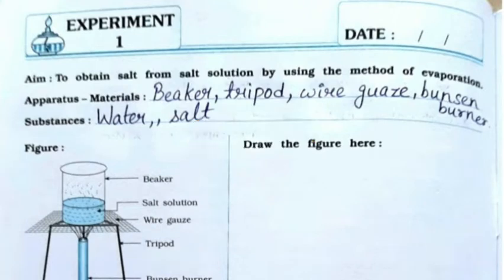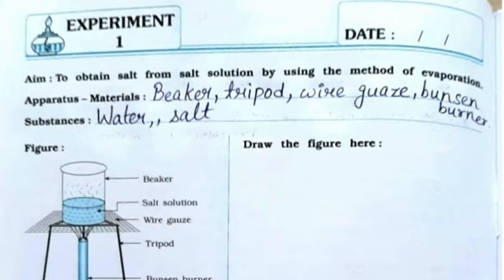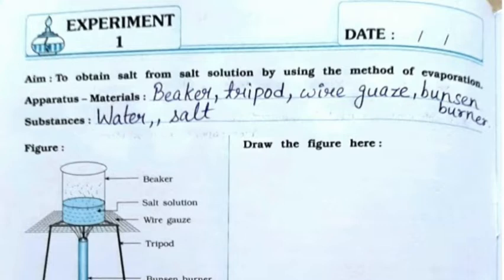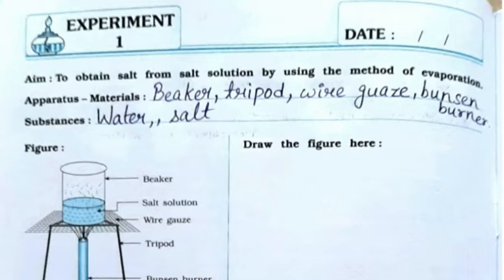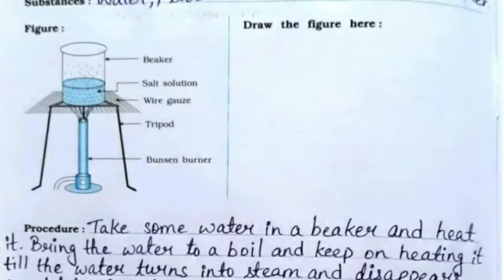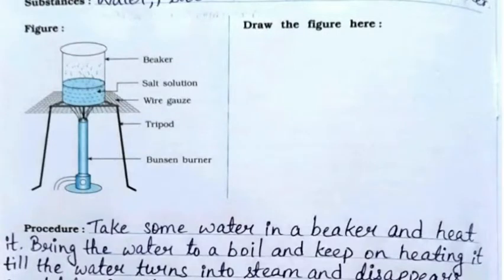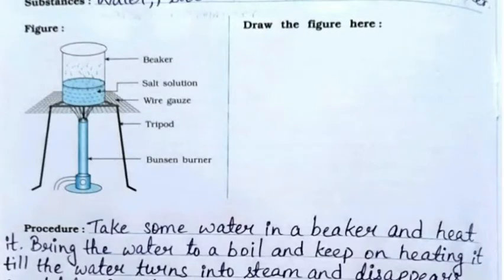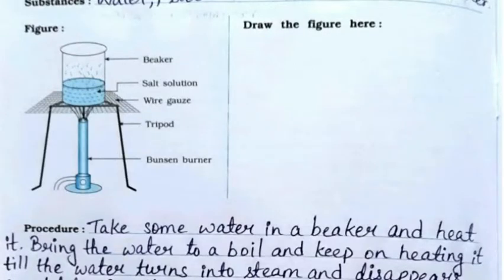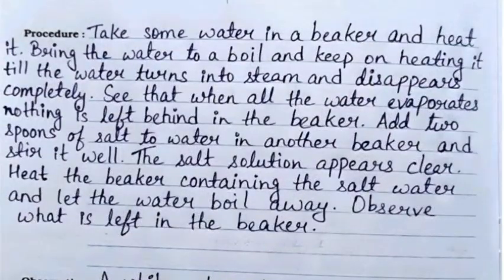The aim is to obtain salt from salt solution by using the method of evaporation. The apparatus and materials are: beaker, tripod, wire gauze, Bunsen burner, and the substances are water and salt. You need to draw the same figure which is shown on the left hand side.